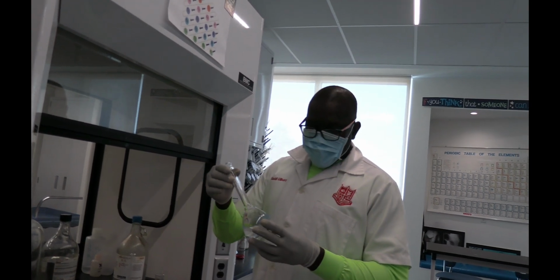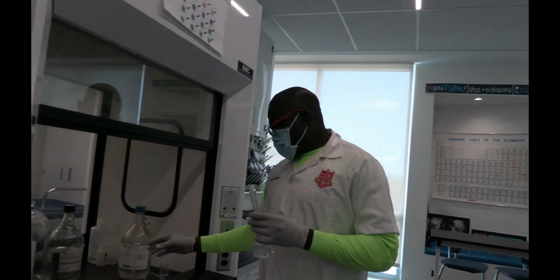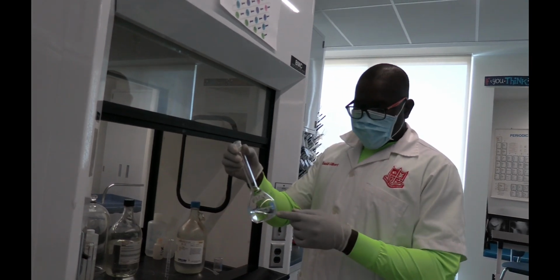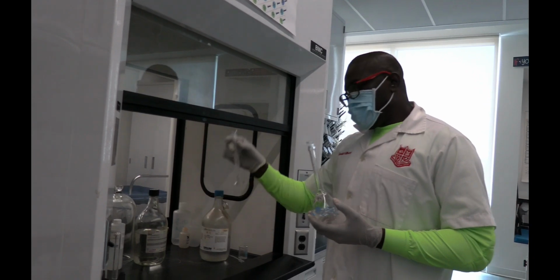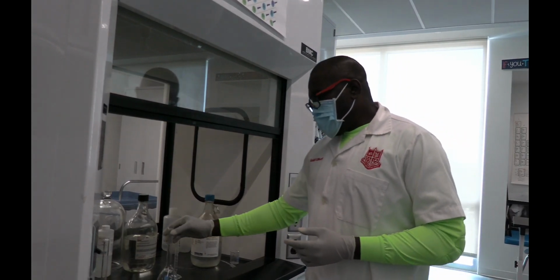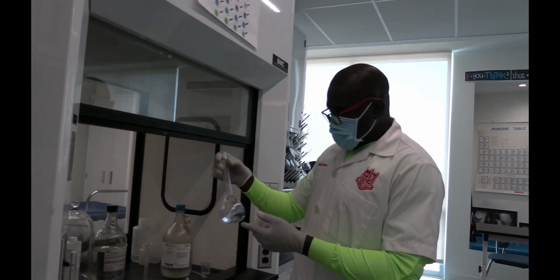Okay, so we are doing a titration, and this is a colorimetric titration at that. First thing we want to do is make up our standard solution. So this is a volumetric flask. This is a 250 ml vol flask, and I've already measured my hydrochloric acid, which is concentrated hydrochloric acid. So I'm doing all of this under the fume cupboard. So I added a little water to my flask.